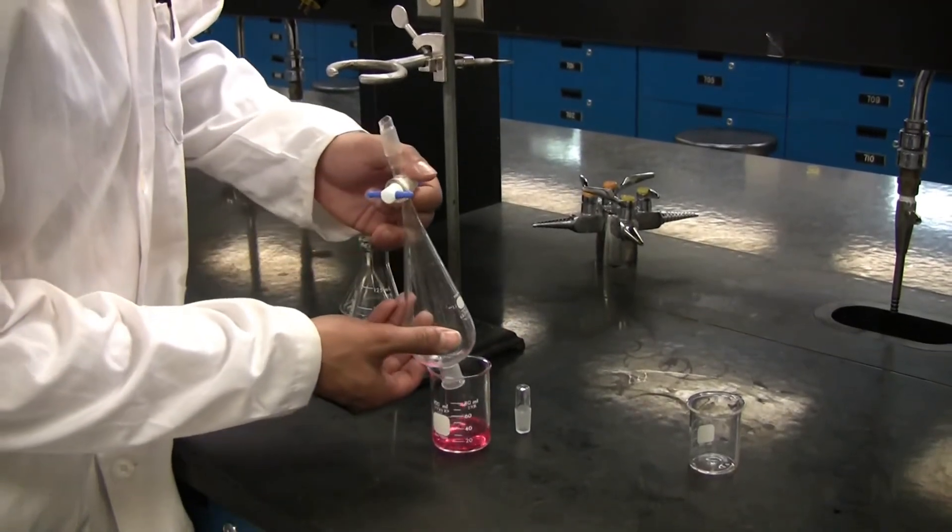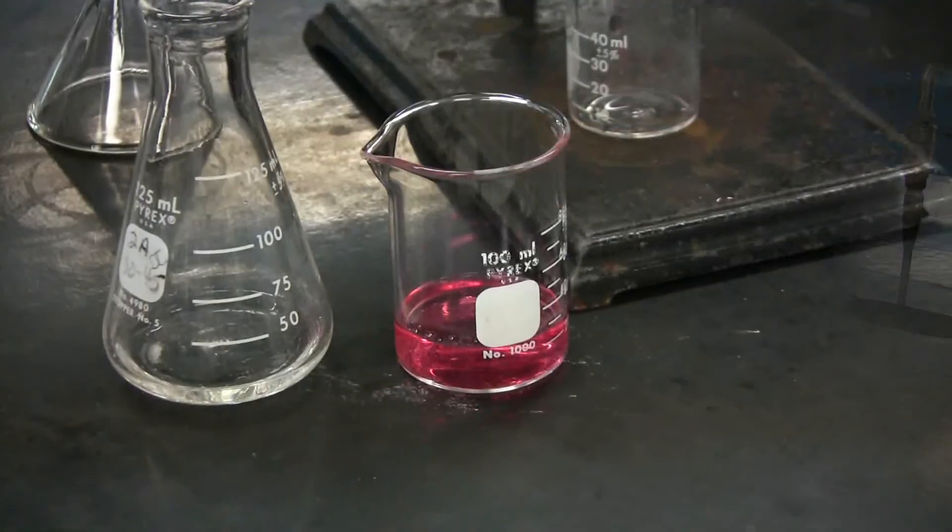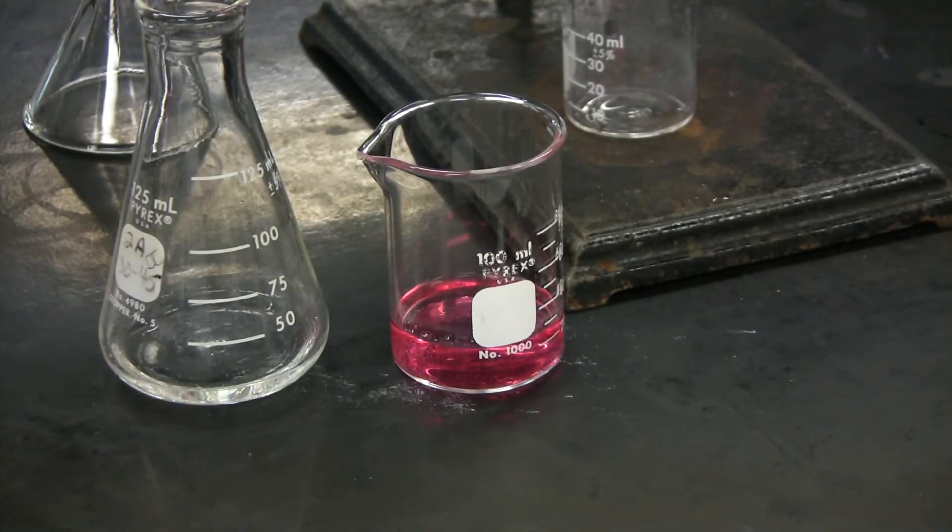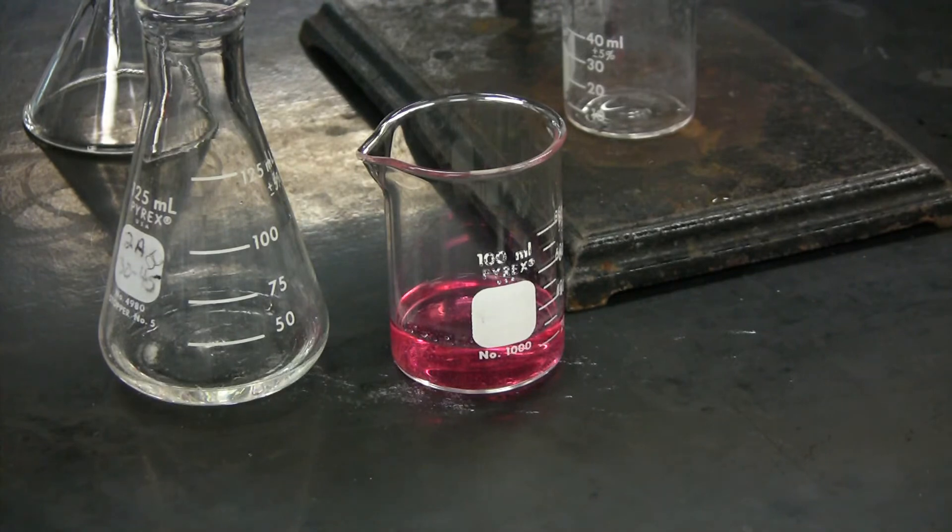You now need to determine which of the layers is the aqueous layer and which is the organic layer. Be sure to reference the density chart to determine which layer you need to keep.